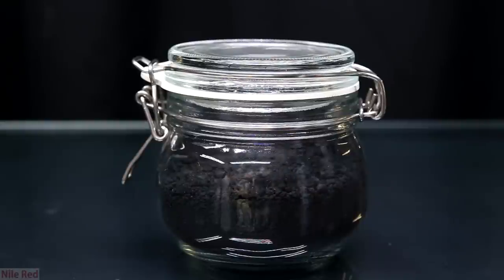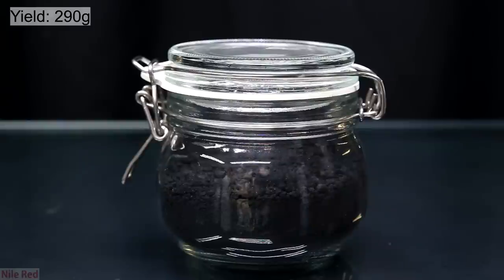So the next thing that I did was I transferred it to a container for storage. The recovery of manganese dioxide from the batteries was about 290 grams. I think I can assume that I probably lost something like a gram per battery. So this means that each battery probably contained about 30 grams of manganese dioxide.